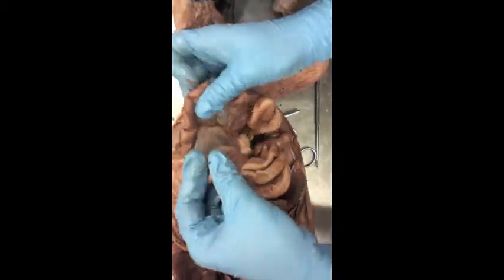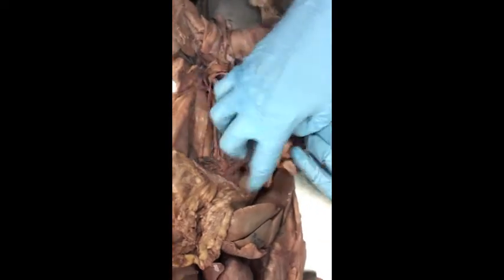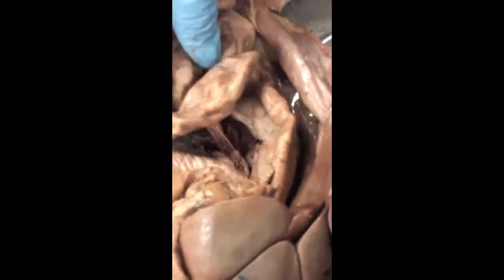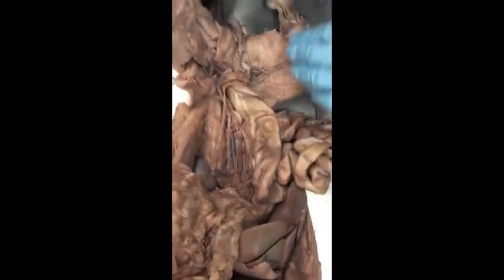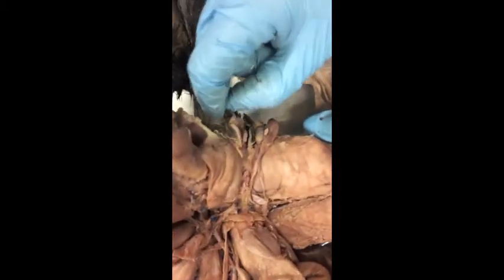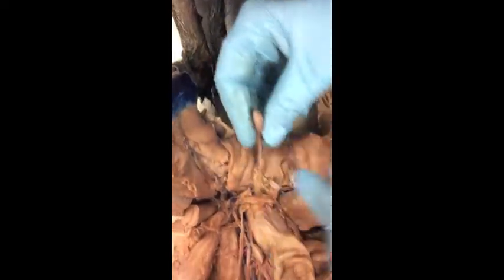Within the small intestine, if we fan out the small intestine, we can see the mesenteries that are holding all of the blood vessels going to our small intestines and anchoring them to that back wall. We already covered kidney, ureter, bladder. Now this is a little boy kitty, and we have already opened up the scrotal sac. So down here is the skin that was holding on to the testes, so they were tucked inside there. They have been extracted. So here is a testis.